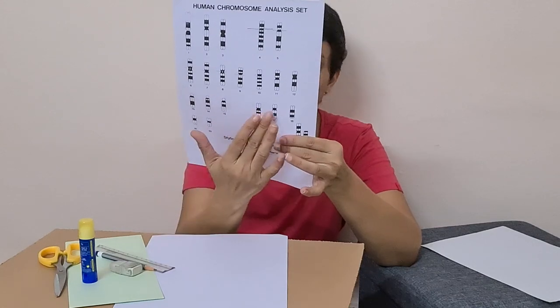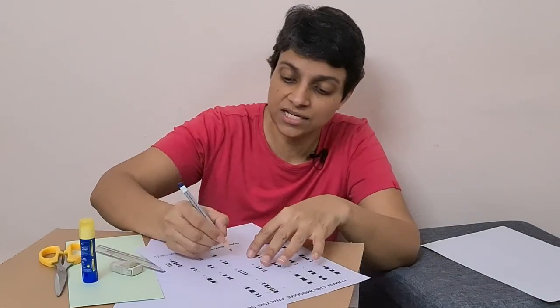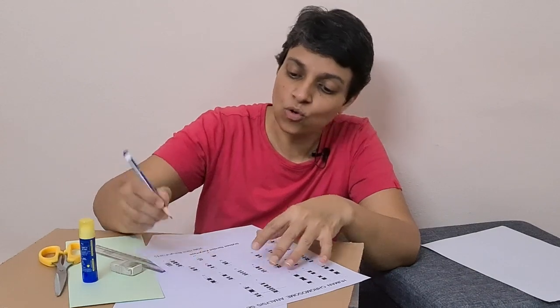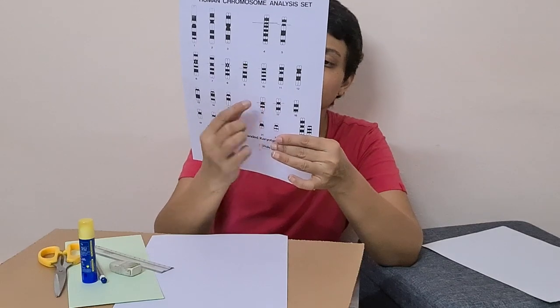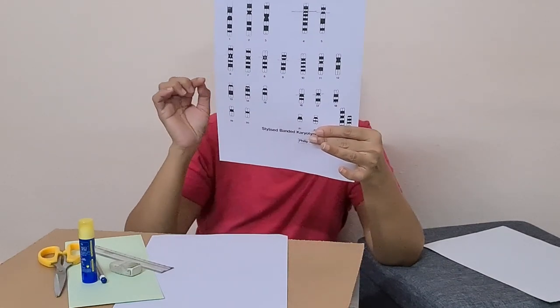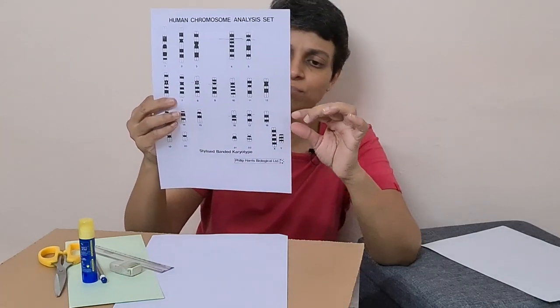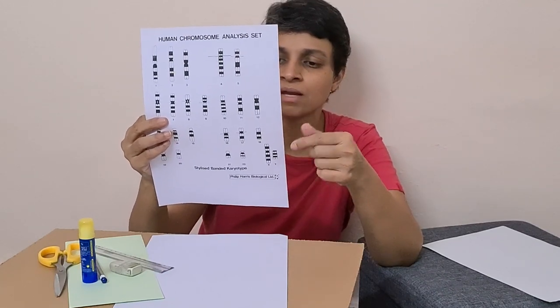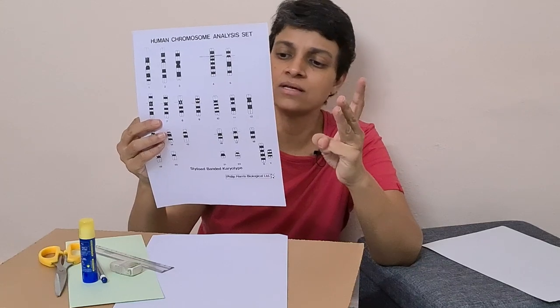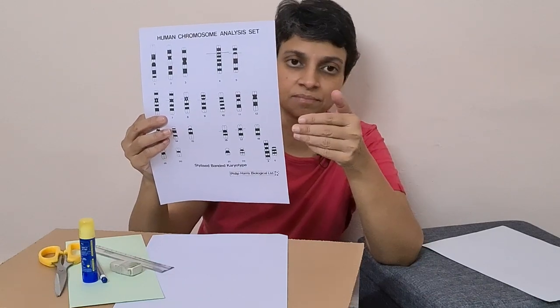Group E is small submetacentric. Small submetacentric chromosomes are placed in group E. The P arm is shorter and the Q arm is longer, but they are smaller overall compared to group B. They are three pairs — chromosomes 16, 17, and 18 are in group E.